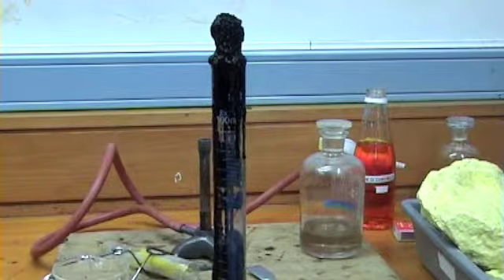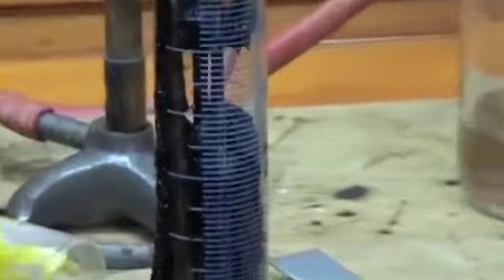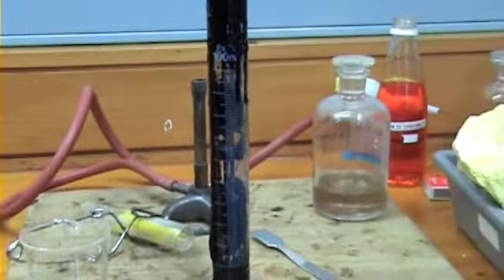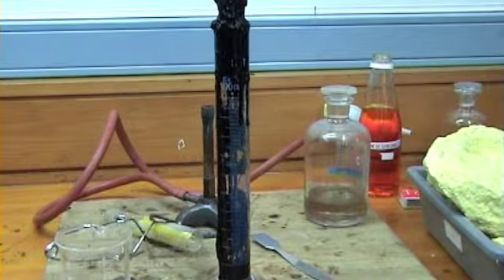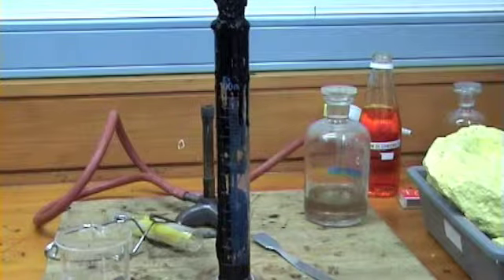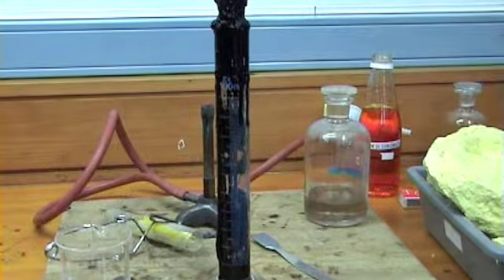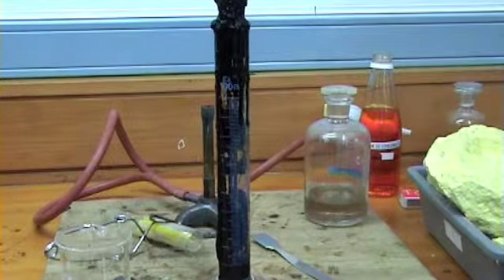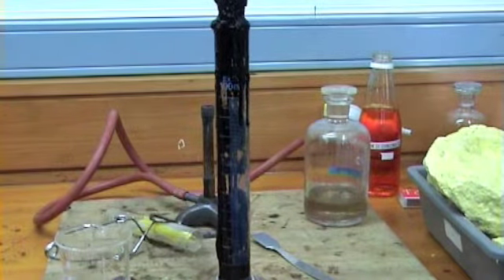Push it. Oh my god. She's going hard. Sounds nice. So sulfuric acid and excess. Hopefully about the right amount, so about even. Sounds so good. I know it does. All right, that's probably it. Can we touch it? No. Sulfuric.